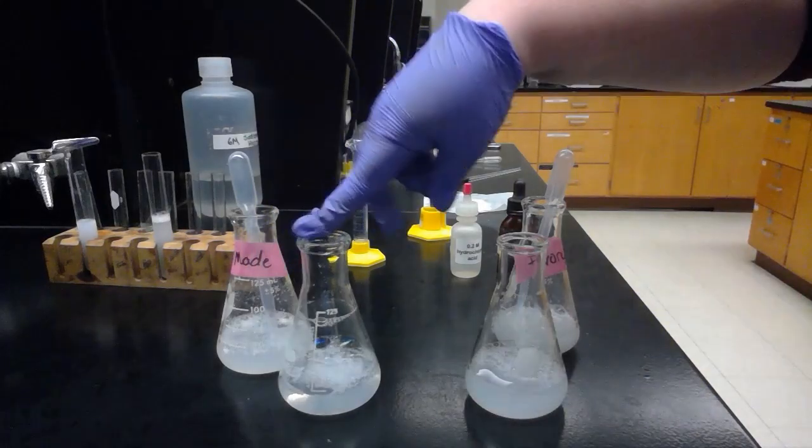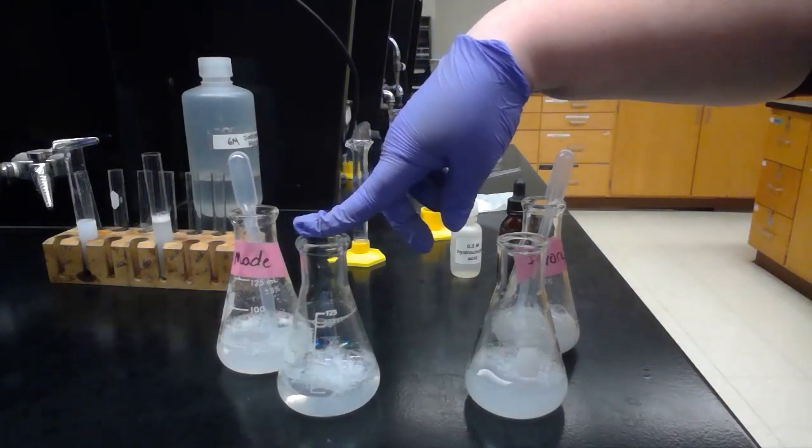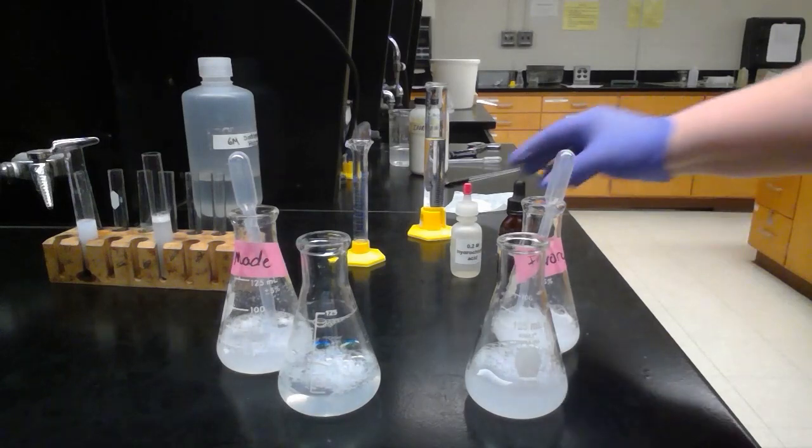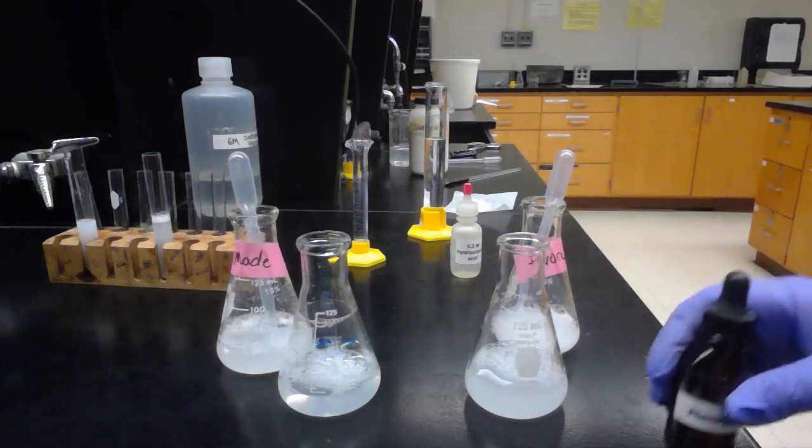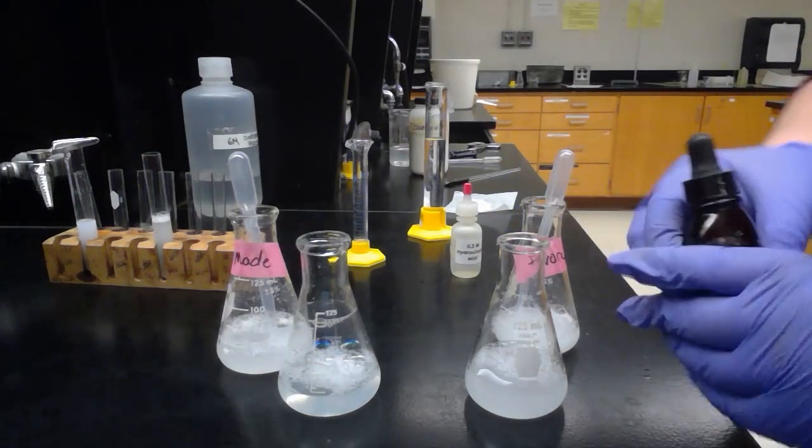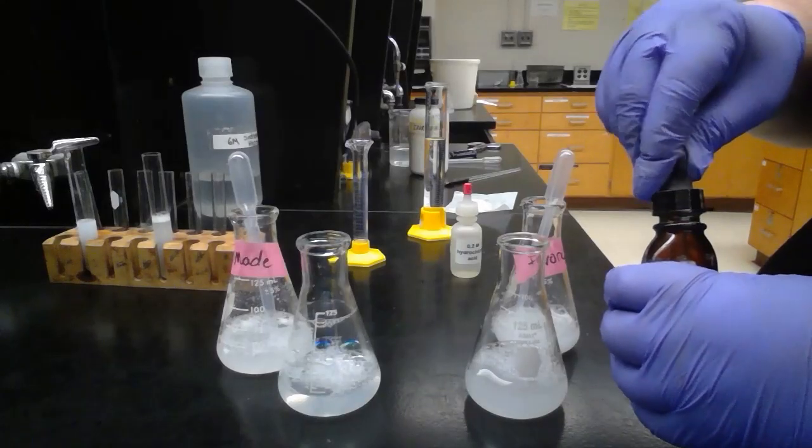I did the same thing with my sample soap or the made soap. Now I'm going to add five drops of the phenolphthalein and that's going to be our pH indicator.